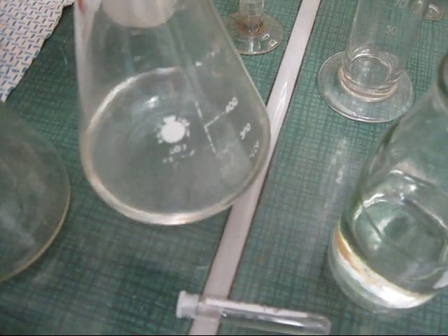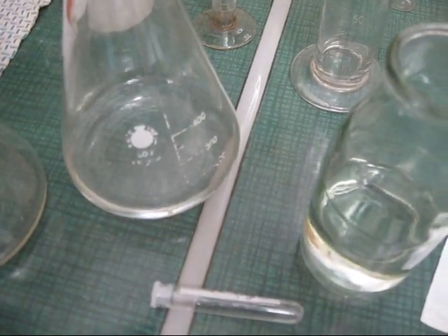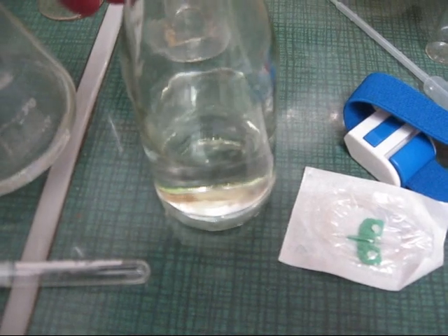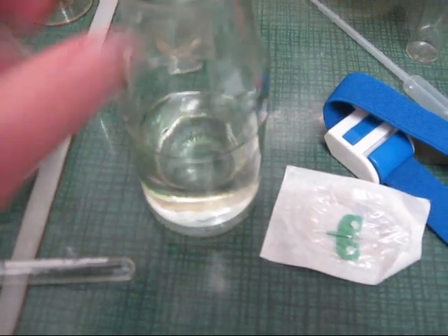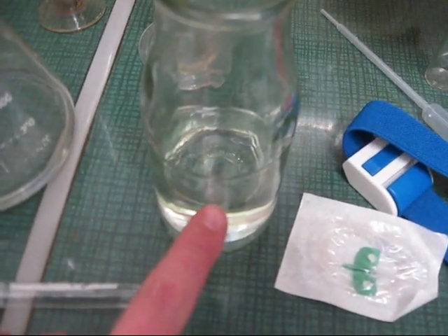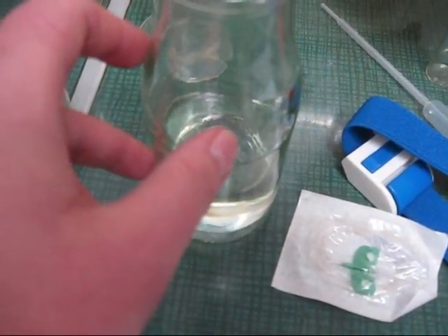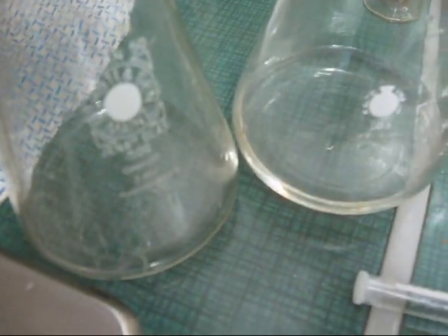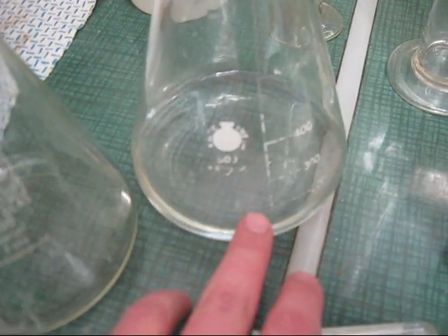And 100 milliliters of distilled water with sodium chloride. And another 100 milliliters of water with the sodium chloride. I will gargle this solution and see how well I can extract DNA from my mouth. Now I also put blood into those two containers. Last time the blood didn't work all that well.